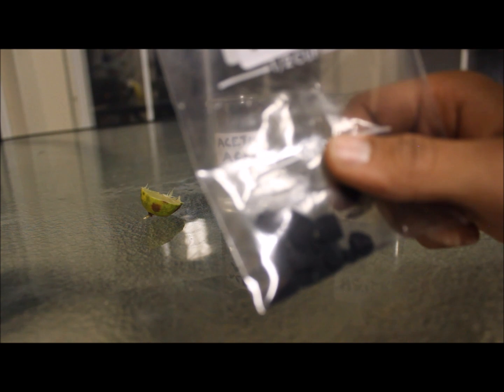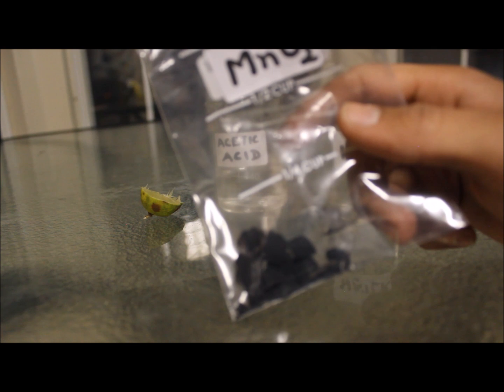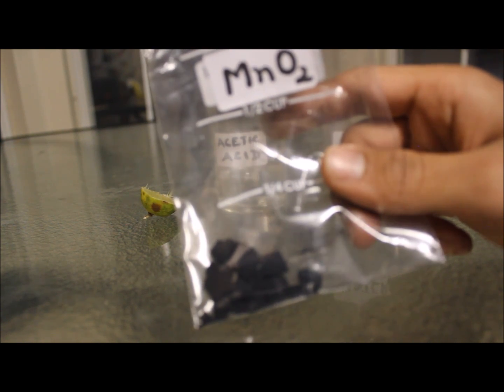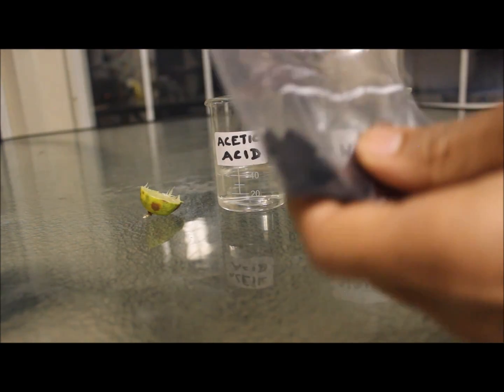One of the most annoying things about working with this manganese dioxide is what it does to your hands — it stains your hands terribly. It doesn't do any harm, but it's really difficult to take that off even with water, so I have a very simple technique to take this away.